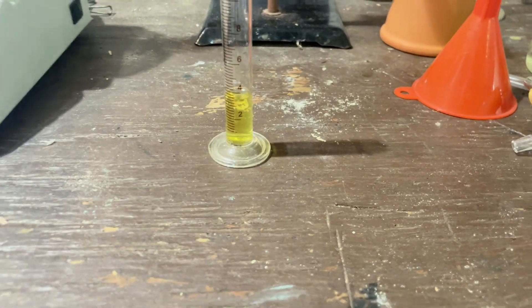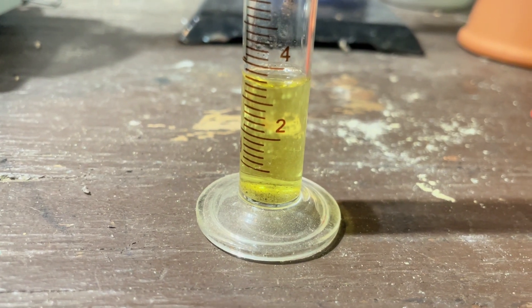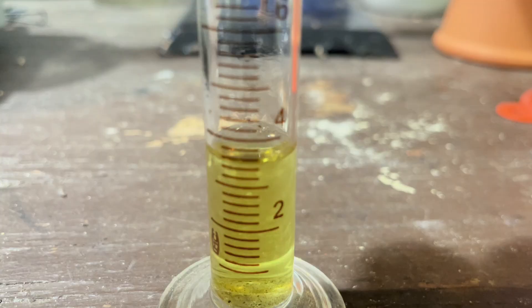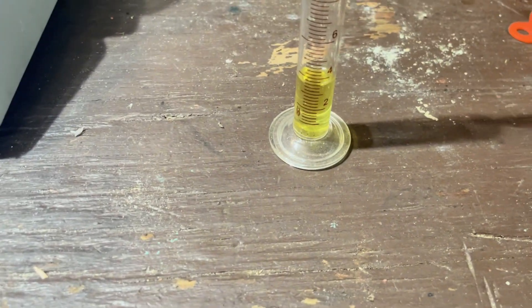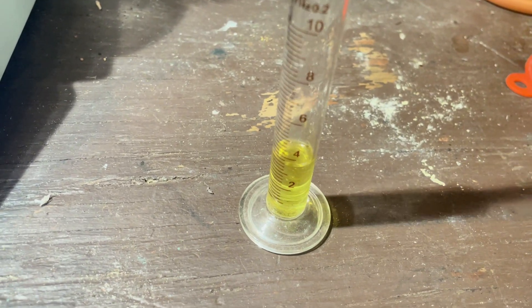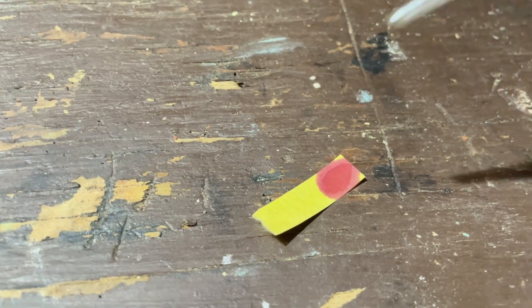Here we are after I have distilled everything. This is not completely azeotropic nitric acid — there's probably still a bit of water in here. I don't know exactly what concentration it would be, but I have about a little under four milliliters of it from a 10-hour run. Let's see what a pH strip thinks of it. Very acidic.